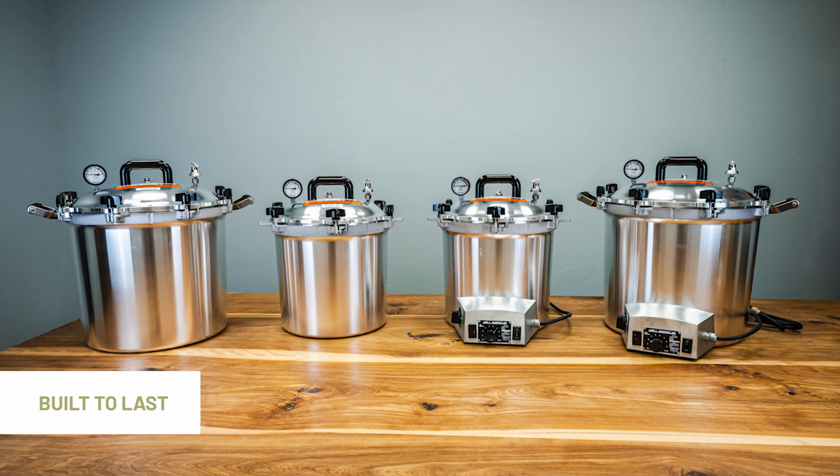This inspection will help ensure your sterilizer operates safely, seals properly, and maintains consistent pressure, which ensures safe, dependable sterilization within every batch.